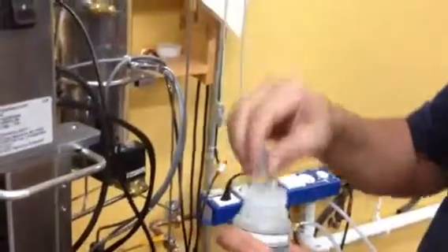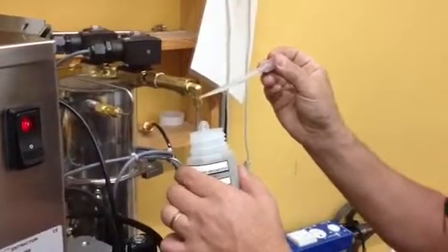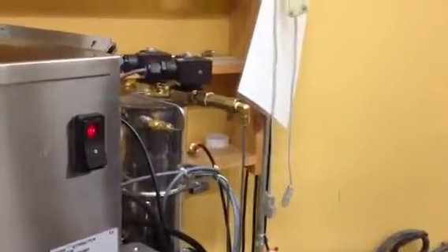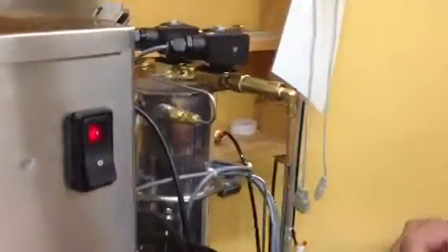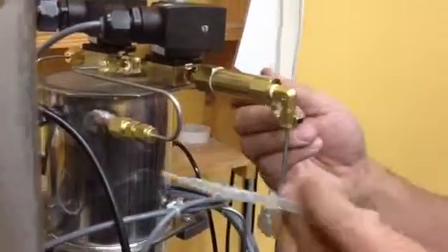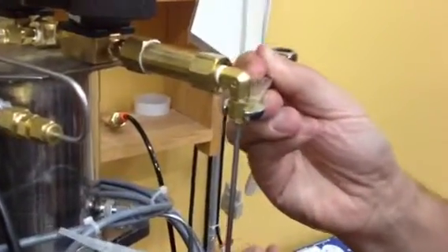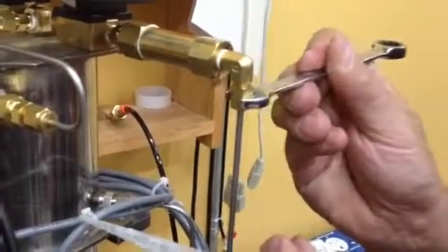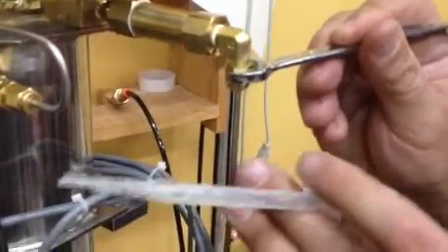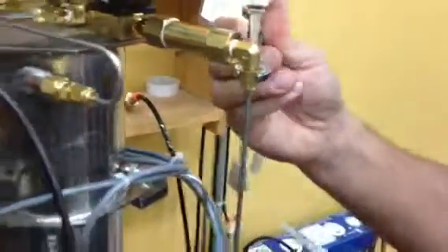I use a little dropper to drop a little bit of the solution around my fittings where I think there might be a suspect leak. Now, I'm going to try to cause a leak so you understand exactly what will happen here. I need to grab my wrench. Now this is under pressure. I'm only going to do this to show you what a possible leak will look like. I'm going to crack it very little. And you'll see the bubbles forming on the bottom here. There it goes. That right there is a leak.